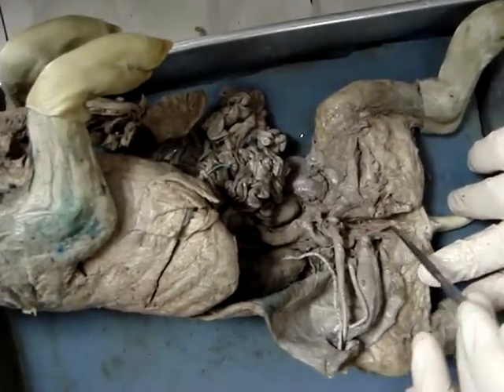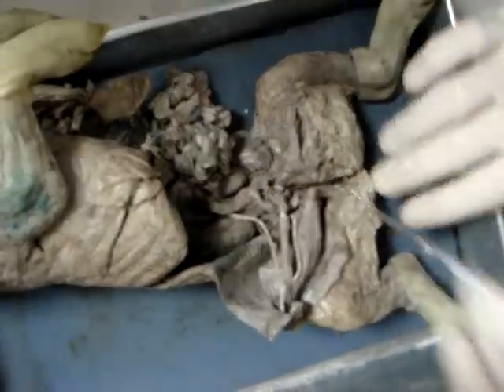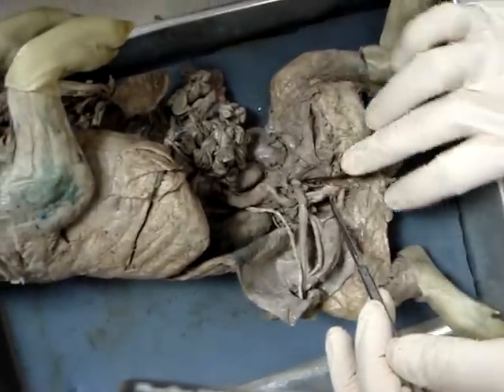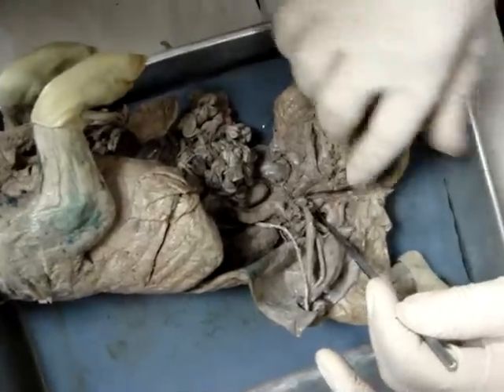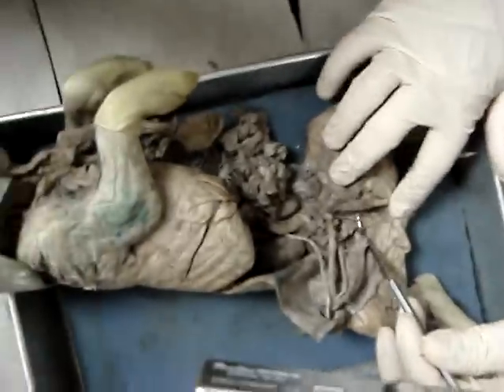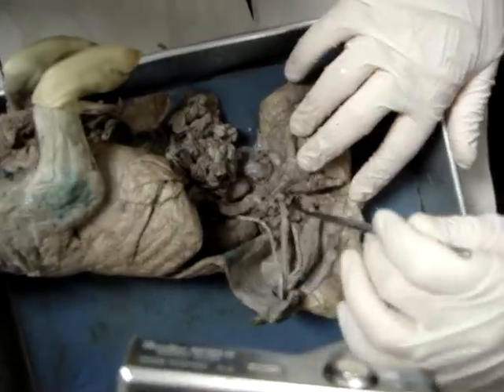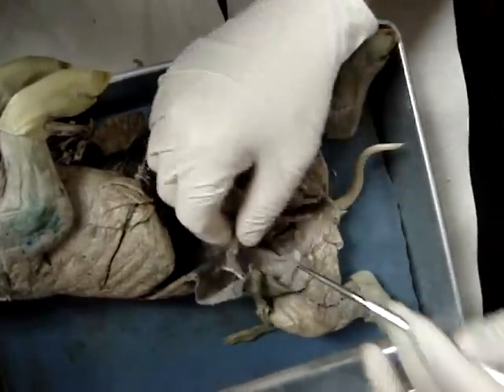Ventral to that tube, we have the urethra. So here's the urethra, and then there's the vagina. Down at the bottom, we have the rectum. So three different tubes running parallel, all exiting the female pig in approximately the same area: the rectum, the vagina, and the urethra.